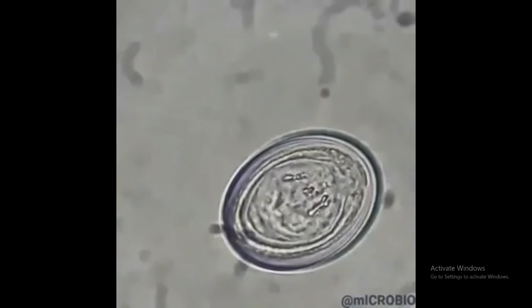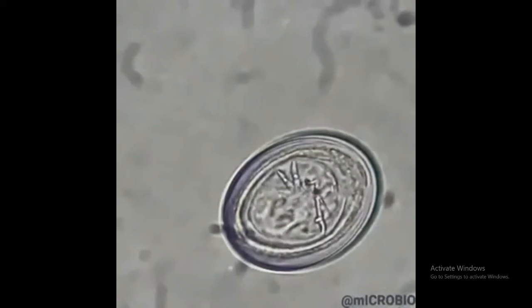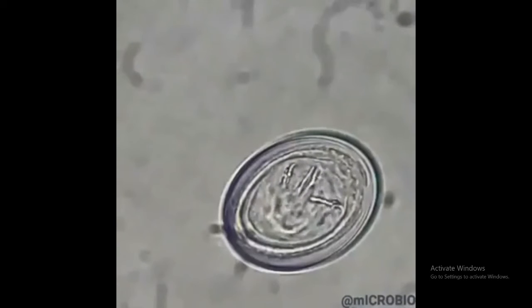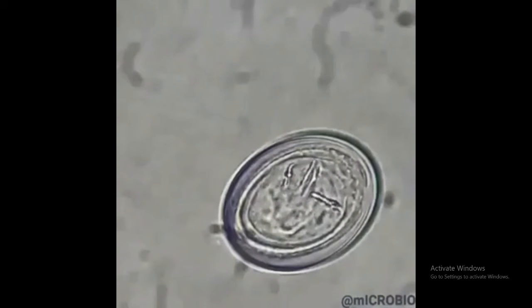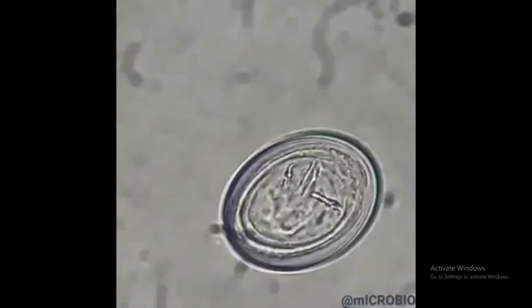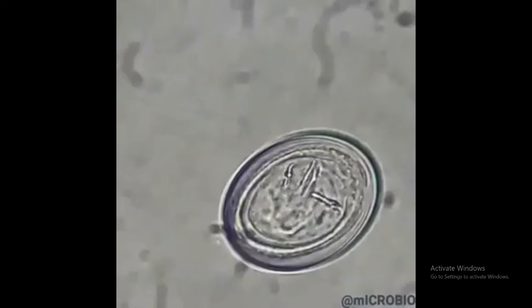So, what is it moving inside the egg? It's called the hexacanth embryo, or the oncosphere. The oncosphere is an embryo which has six hooks, and it is the sign of maturity for cestode eggs.